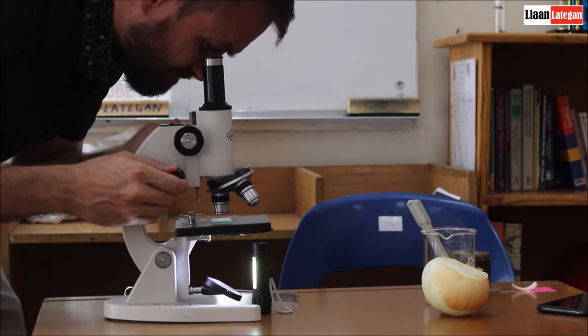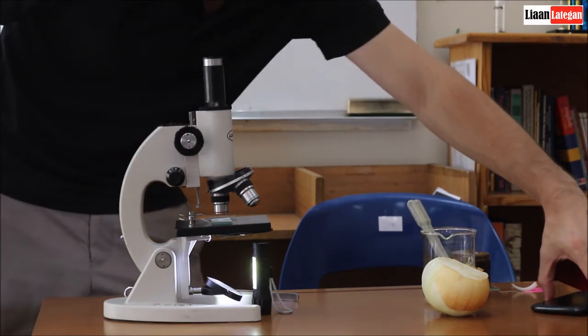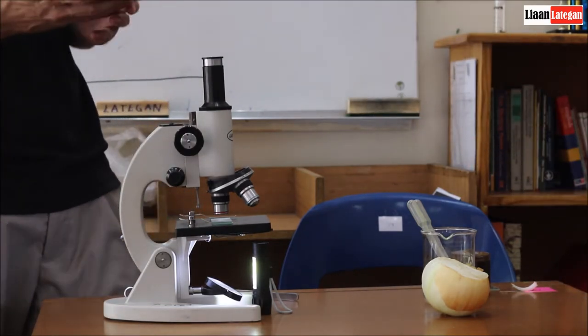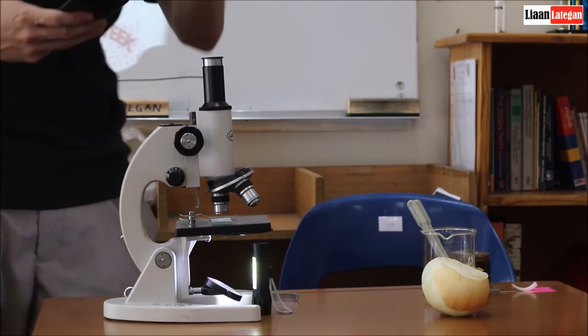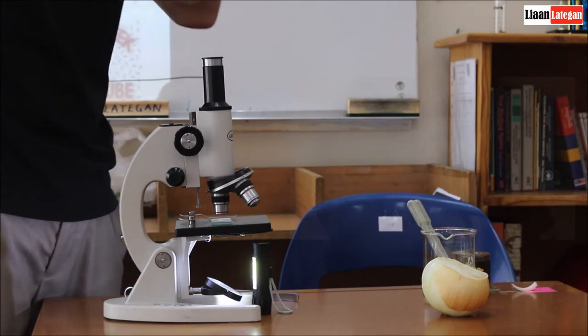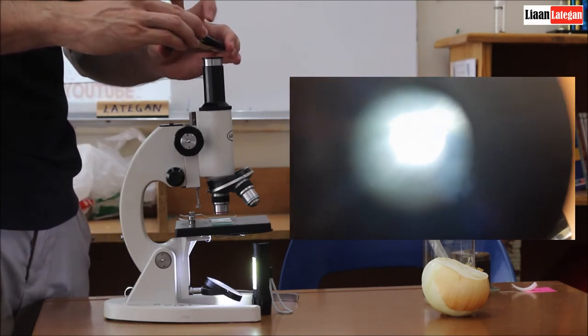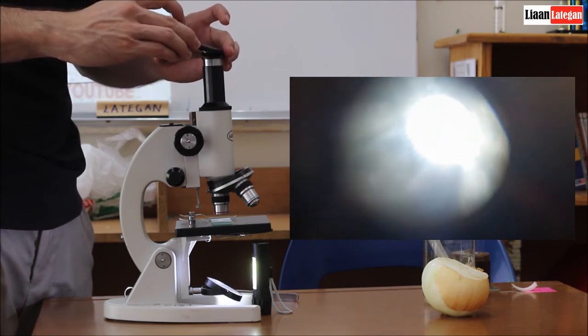And then I just want to refine it a little bit. What I'm going to do is guys, I'm going to take my phone and take a short video clip that I'll insert now. But I'm going to utilize the camera to show you guys what this actually looks like in the microscope.